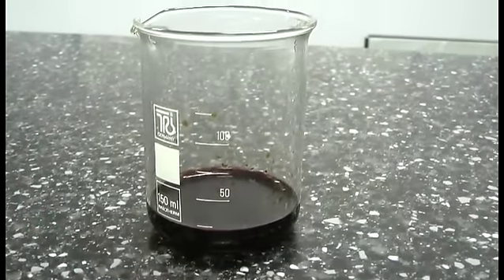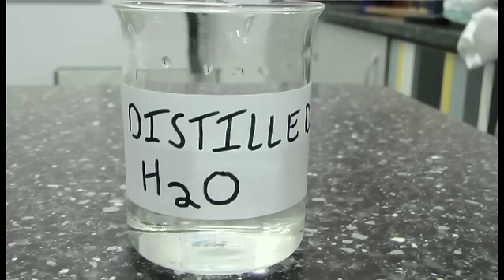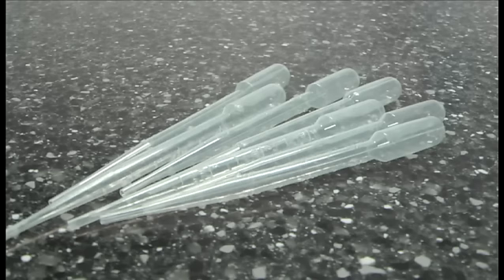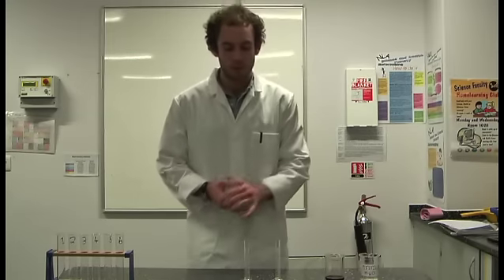So what do you need to do it? For this demonstration we're going to use food coloring, 10 cubic centimeter measuring cylinders, some distilled water, graduated pipettes, a test tube rack, and test tubes labeled one to six. Okay, so this is pretty straightforward guys.